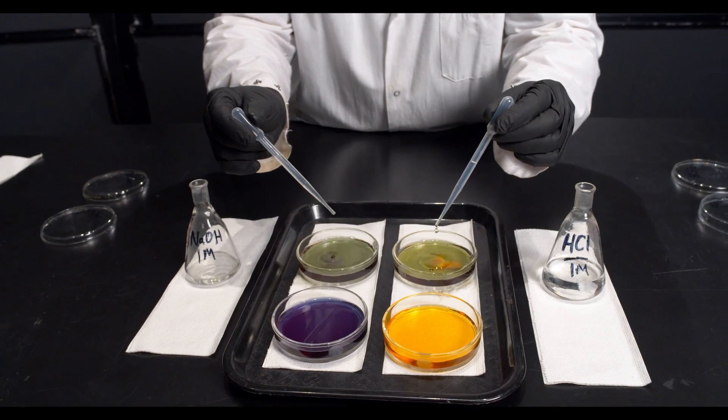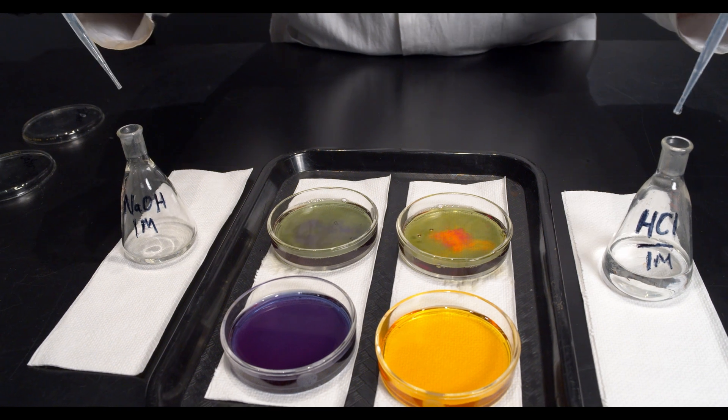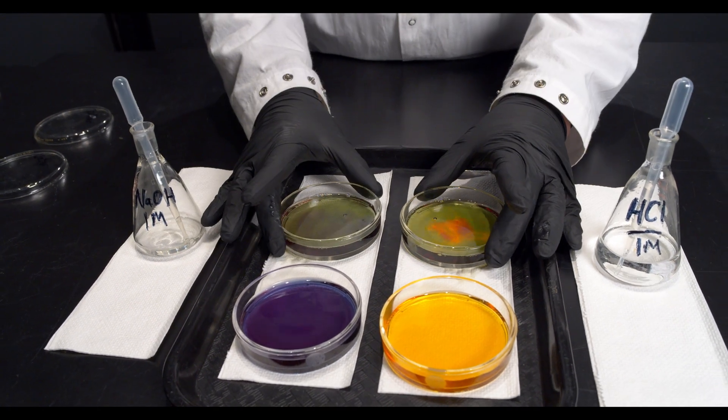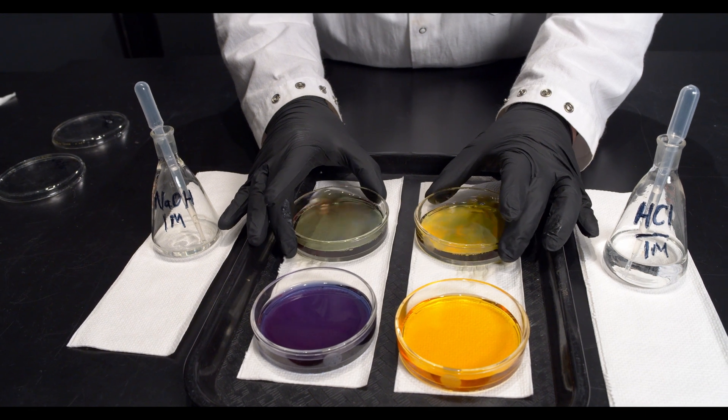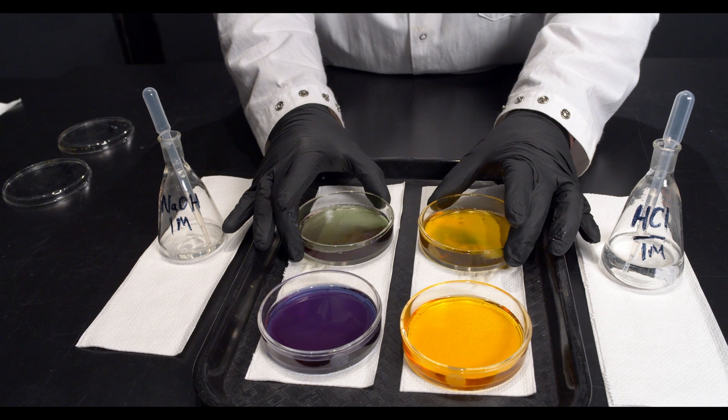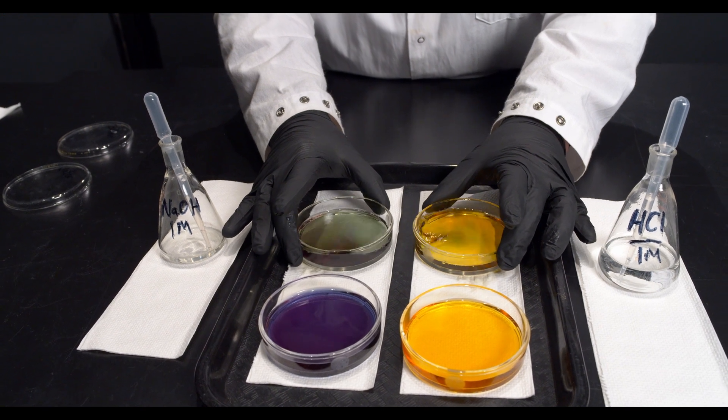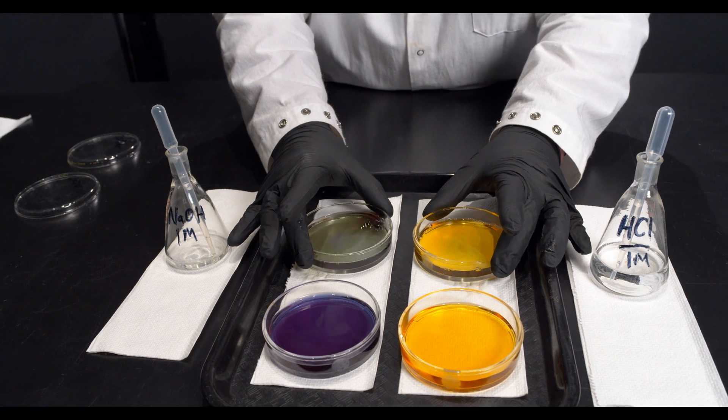Now buffers aren't magic. If I add more acid or base than the buffering capacity, then I'm going to be able to get these solutions to change color, change pH.